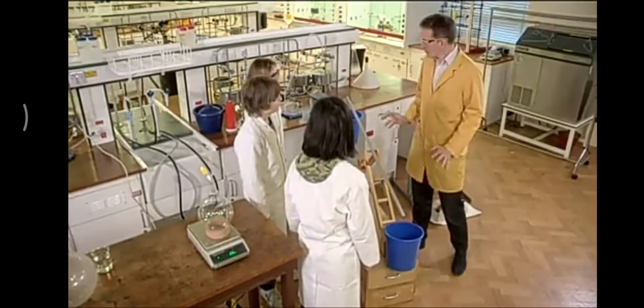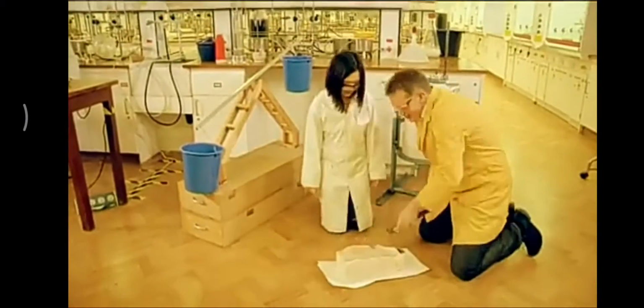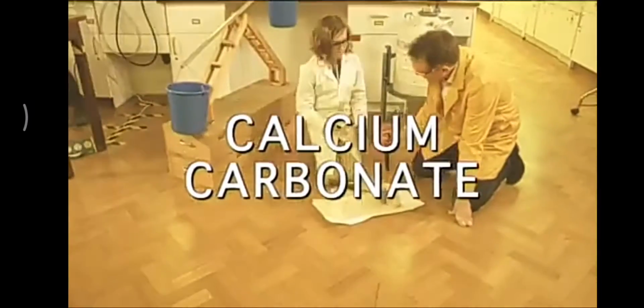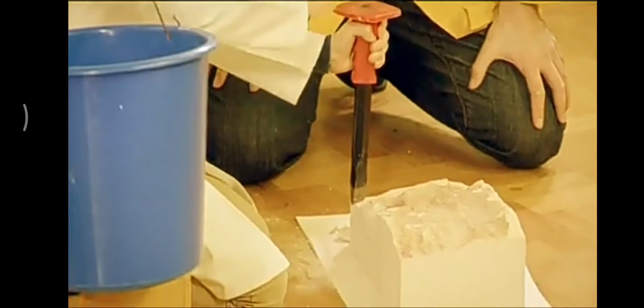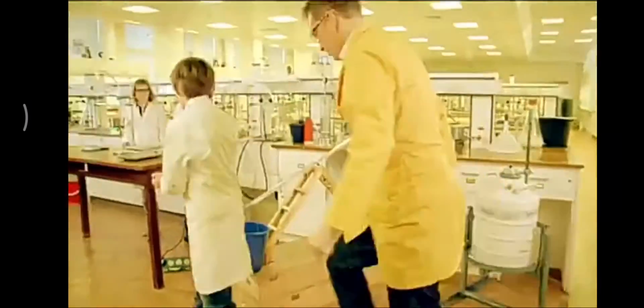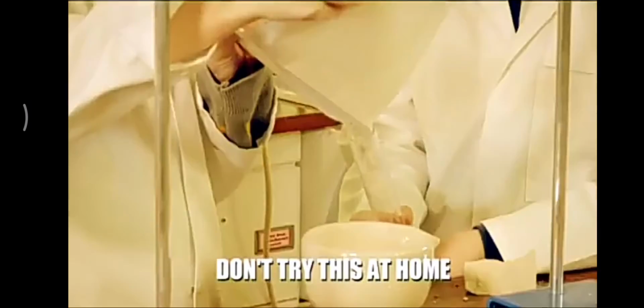So we've seen some of the properties of carbon dioxide, and now we're going to see if we can actually make some carbon dioxide. Carbon dioxide can be made in many ways, even just by breathing out. For this experiment, we are going to make the gas from a rock called calcium carbonate. First, though, my apprentices need to earn their keep as we set about breaking up the rock. These experiments should never be carried out unless supervised in a proper laboratory. Do not try them at home.